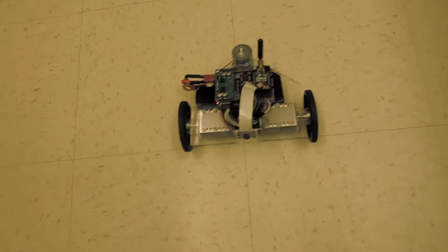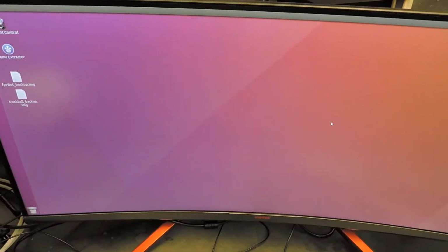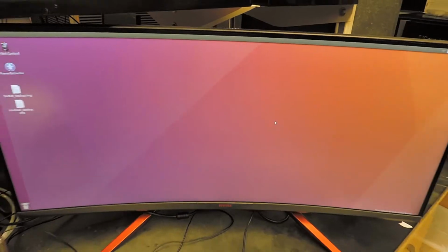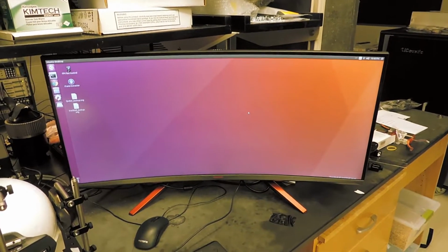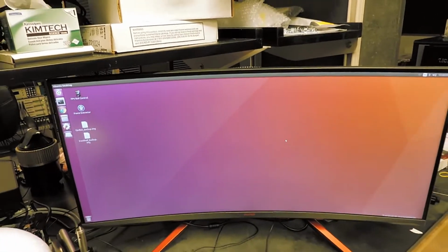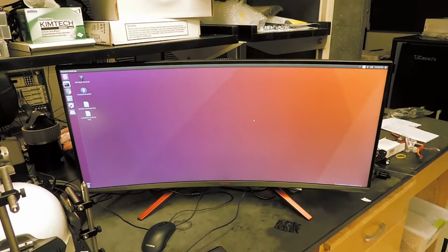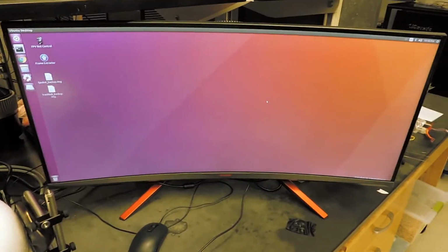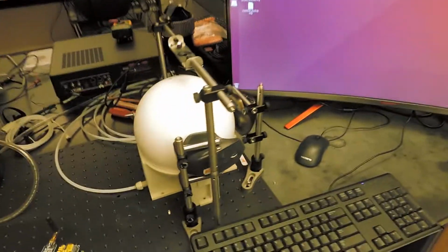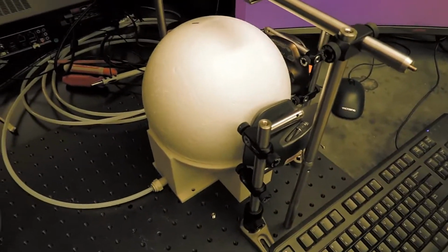And then this video stream is in turn sent back to this display, this heads-up display in front of the mouse. So it will display the video with very low latency, as well as save and extract the video, all of its frames, and all of its timestamps for post-processing. This also captures, it not only transmits but also saves the motion data.